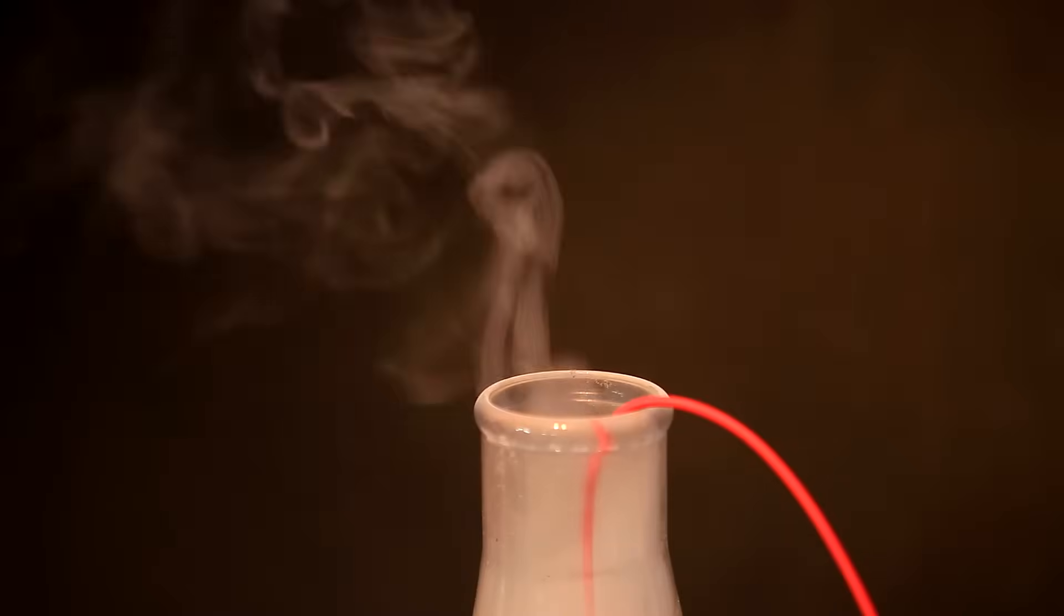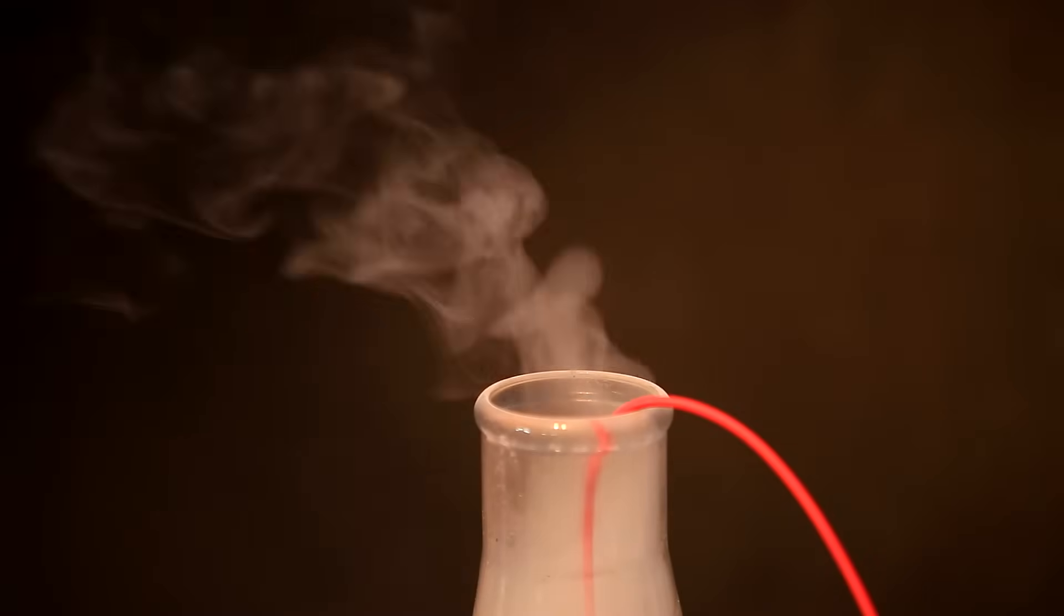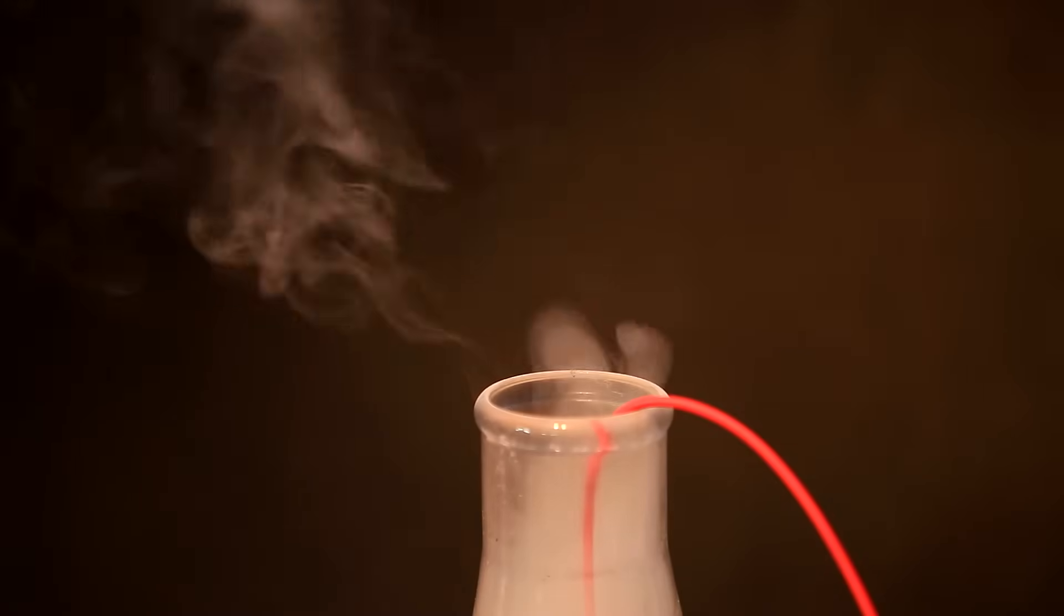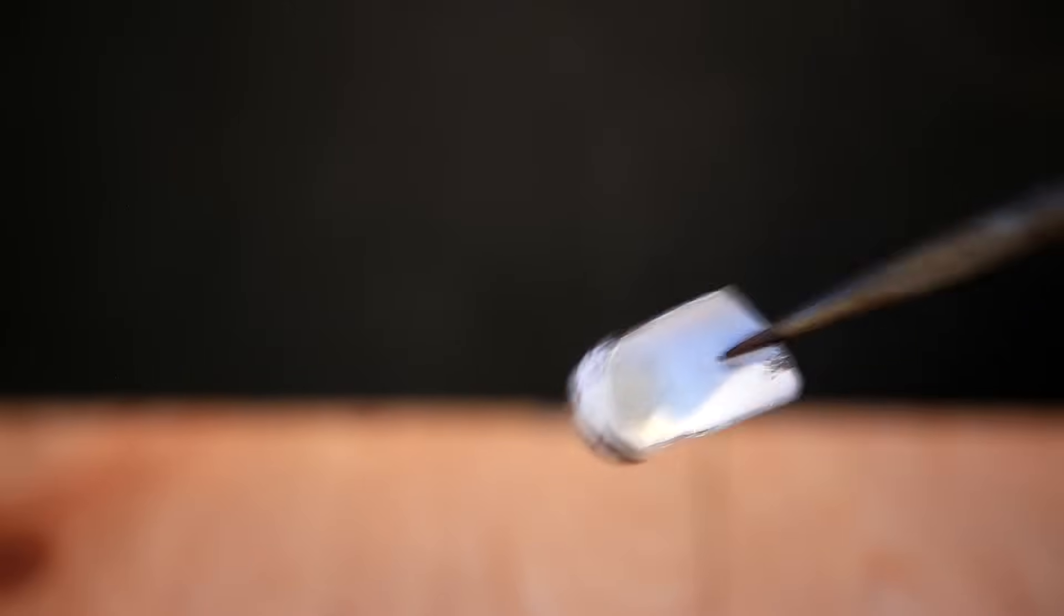Now that the reaction had died down, it's possible to see the reaction going on inside the broken test tube. Compared to the other method where it was ignited using water, this method produced a lot more sodium chloride smoke. The test tube was coated in a thick layer of nice white sodium chloride. I tried to scratch off as much as I could, but it's honestly very hard and stuck very tightly to the glass.